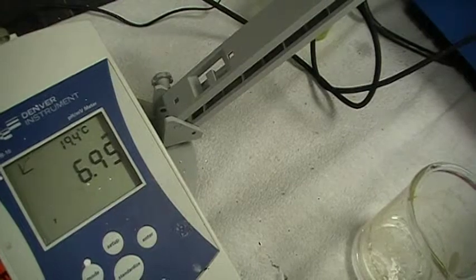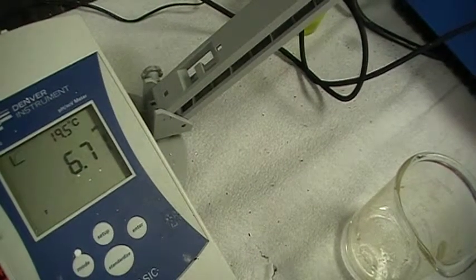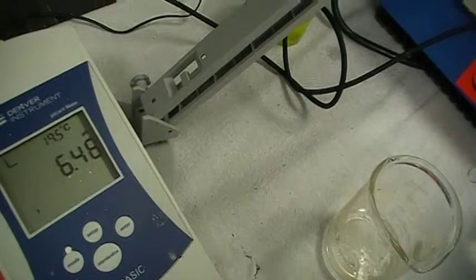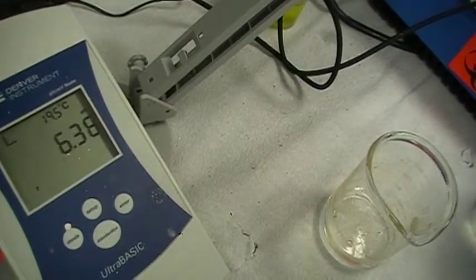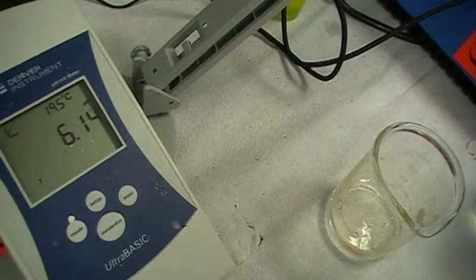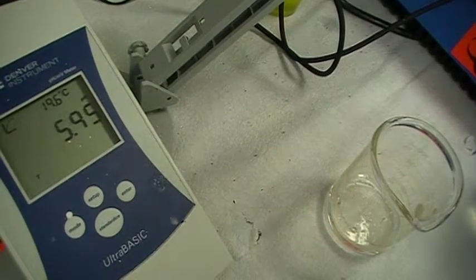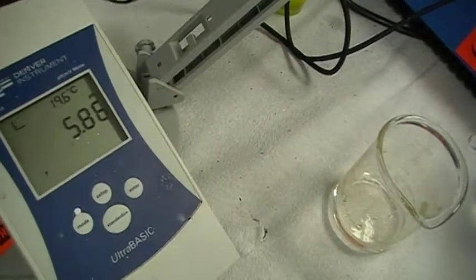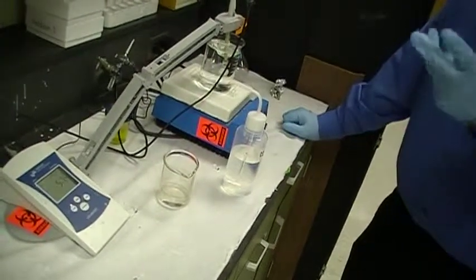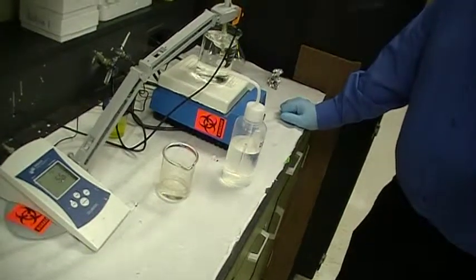We're going to let it read. Well this is kind of scary for the pH of this water. But to finish this out, so you put it in here. And it's going to read the pH and then it's going to stop when it reads the exact pH. And then you begin to add either sodium hydroxide or hydrochloric acid.